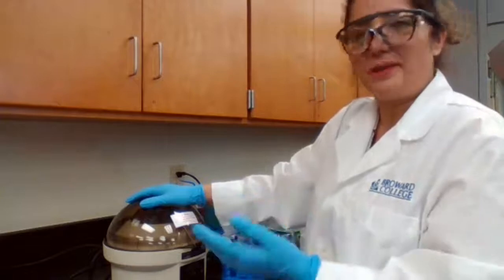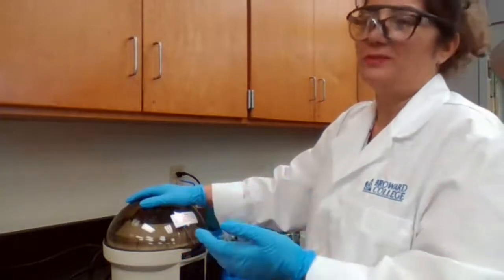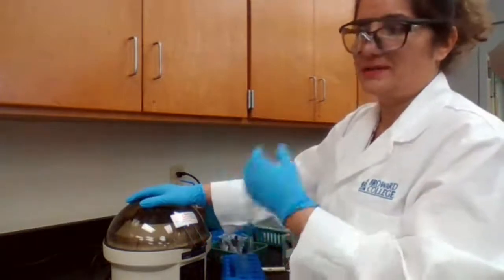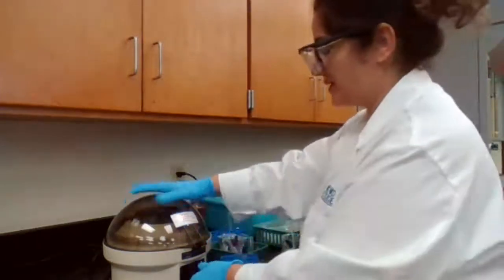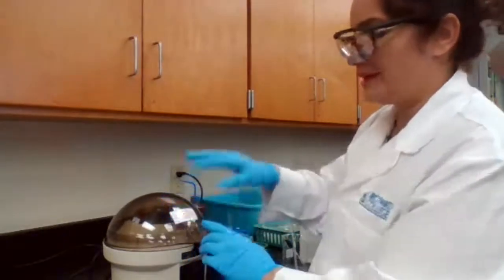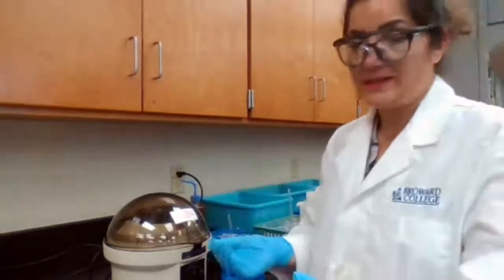With qualitative analysis, we don't have exact measurement. When we say drops, that means it's an approximate volume, because some droppers have bigger drop size, others have smaller. If 10 drops is now 11 drops, probably nothing will happen.